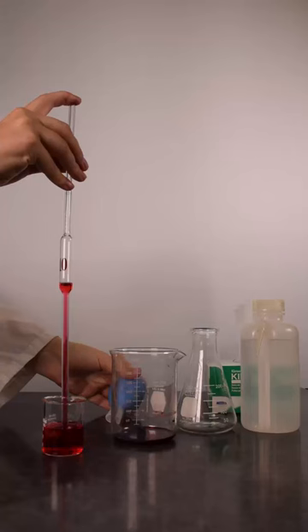Placing the pipette tip gently against the bottom of the beaker slows the draining of the pipette, giving you more time to place your index finger on the top of the pipette without the pipette draining. This technique is called grounding.